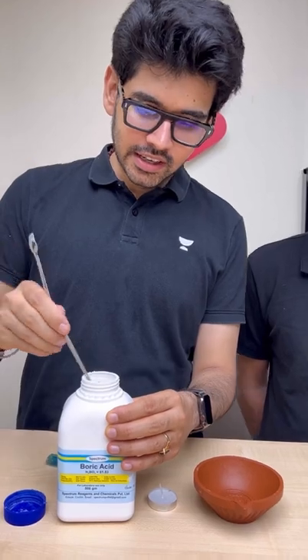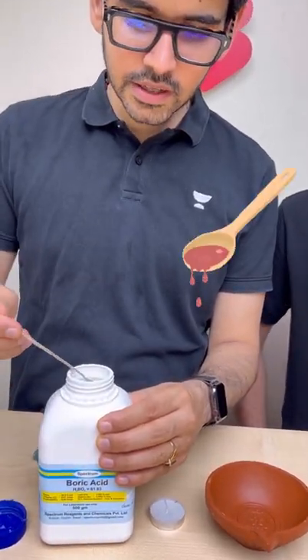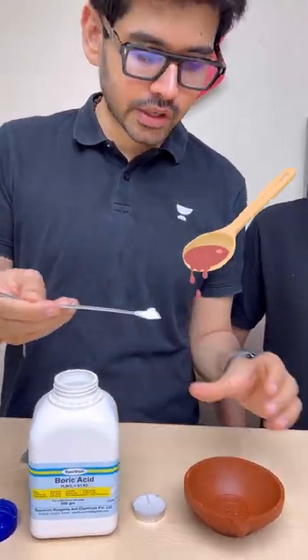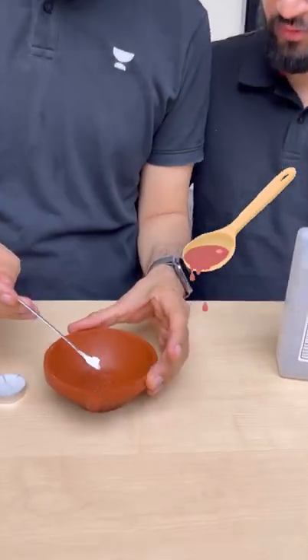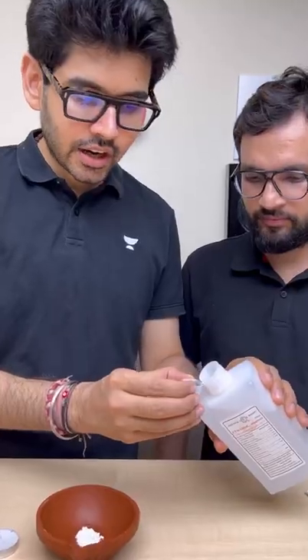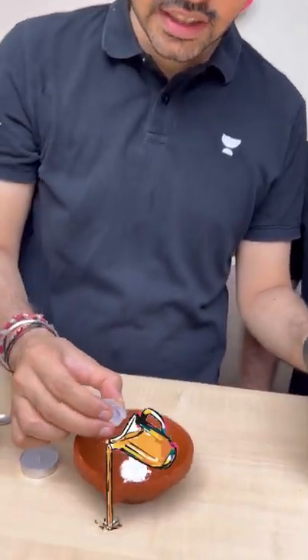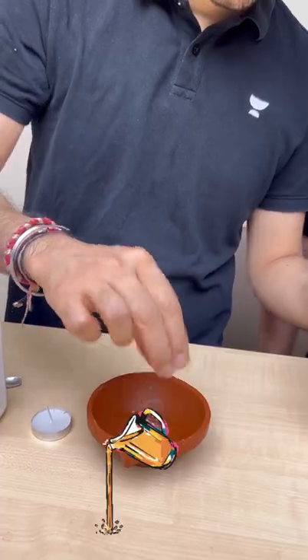So sir, let's take this quantity. Take one spatula of boric acid and give it. Now let's take ethanol and mix it with the boric acid.